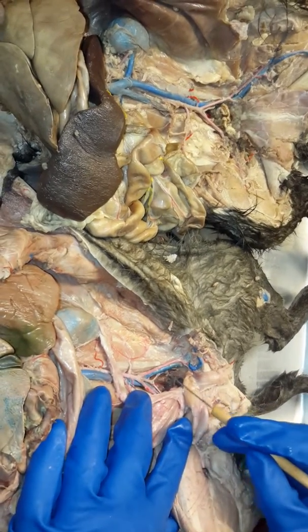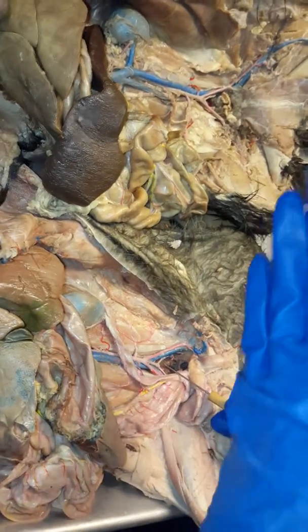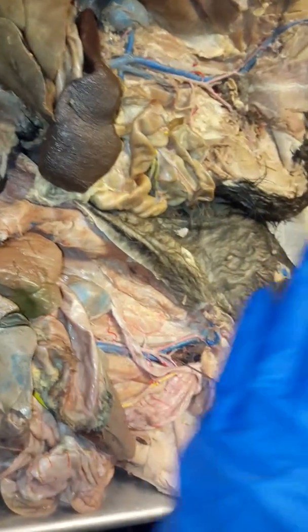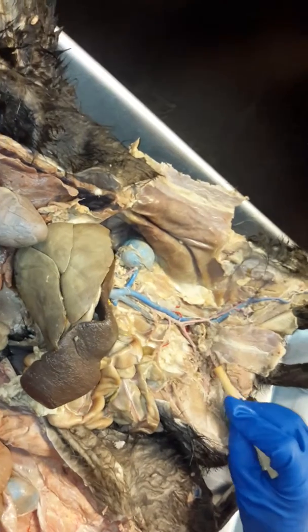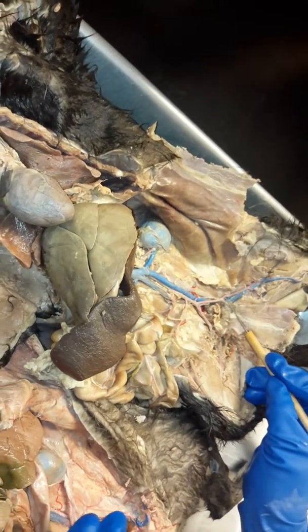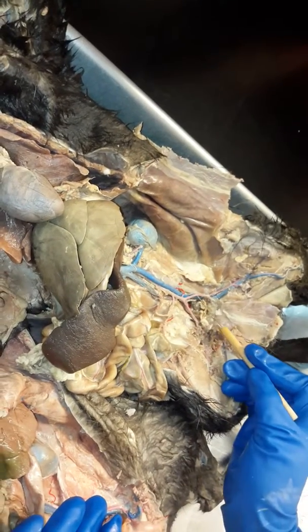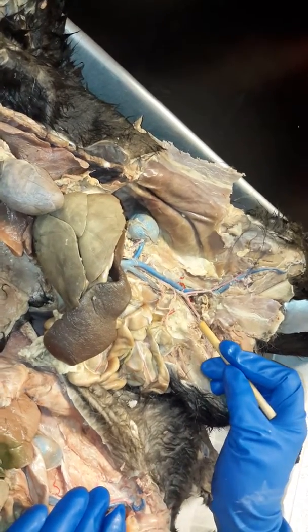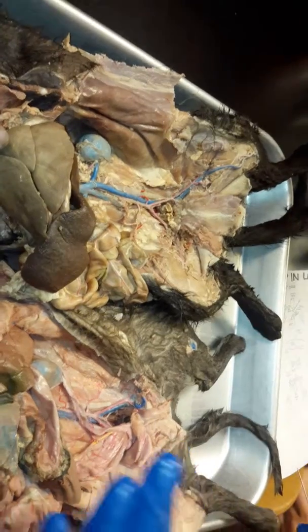Same thing when we talked about the external iliac that went to, once it gets into the leg and it became the femoral vein, same thing with the arteries. Once the external iliac artery reaches the leg, it's now the femoral artery, and then left or right, okay? So this would be the left femoral artery, left external iliac, back to the abdominal aorta, okay? Does that make sense? Okay, cool. All right, that's it.